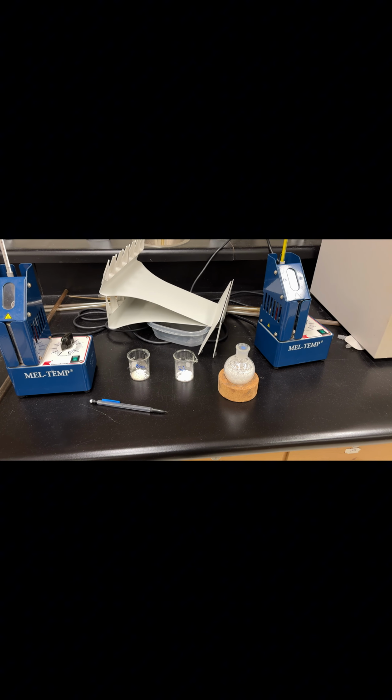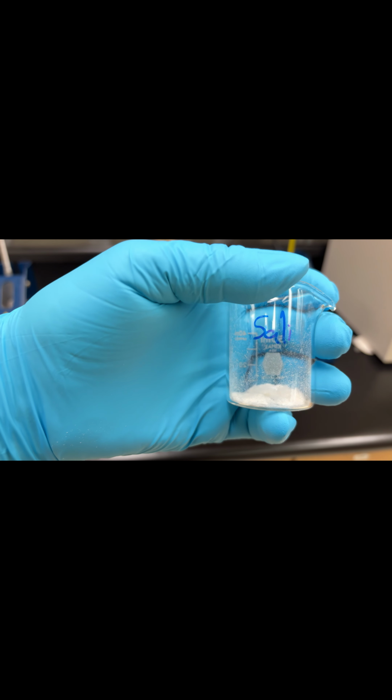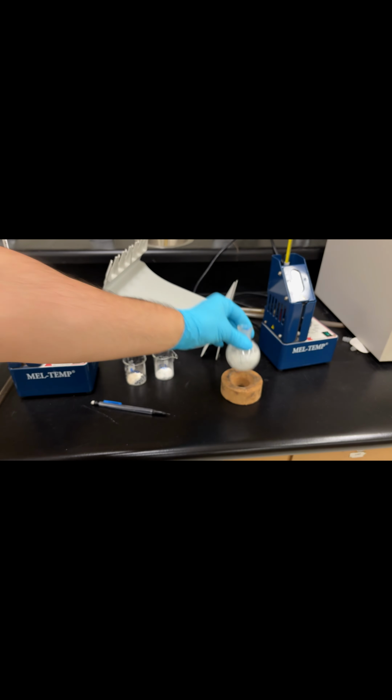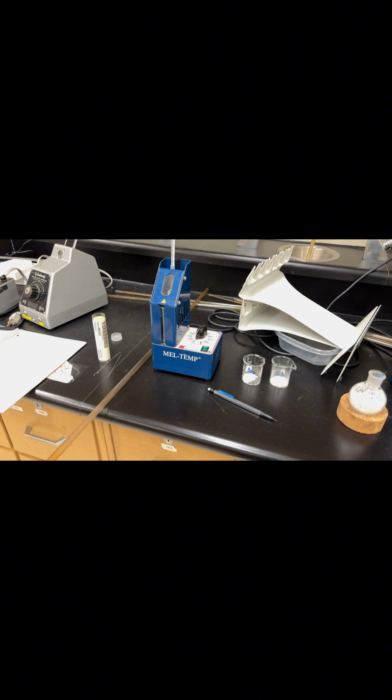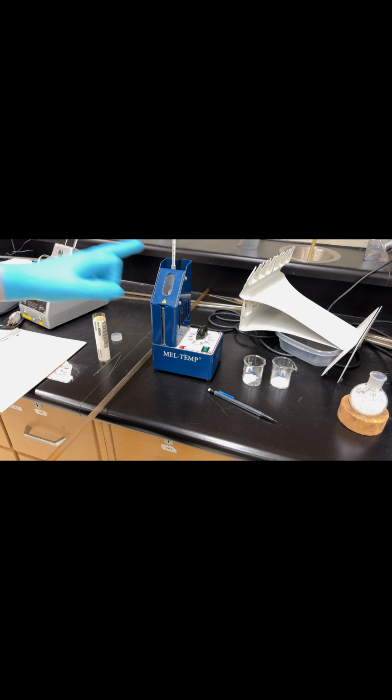Okay, so we have our 3 isolated samples, our aminobenzoate, salicylic acid, and our naphthalene. So the last thing we have to do with these is our melting point. The nice thing is you can do all 3 melting points at the same time, since our melting point apparatus has 3 holders in it. So when you're doing it, just a tip, watch the lowest melting point first, then go up from there, so you can do all 3 at once and keep track of it.